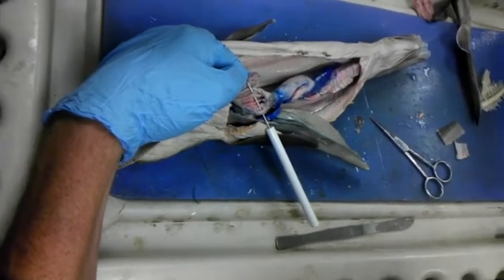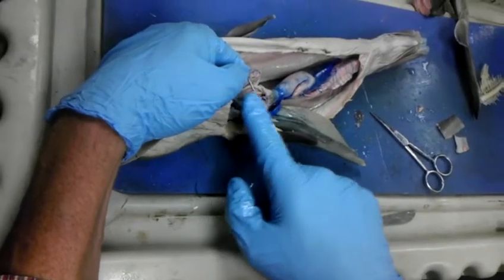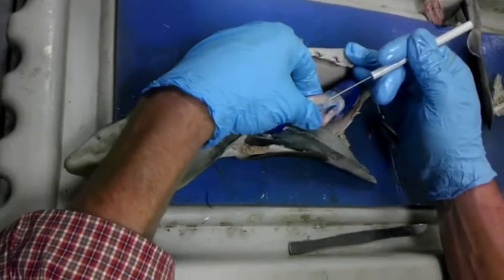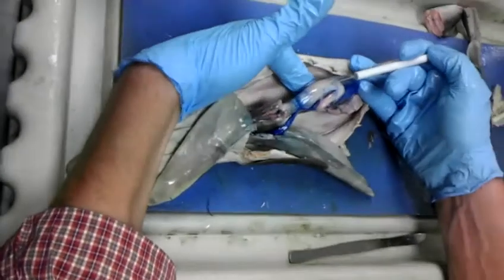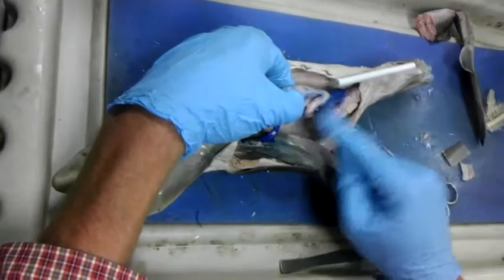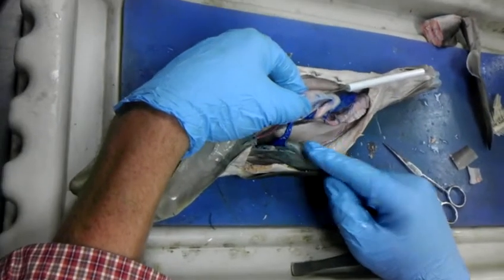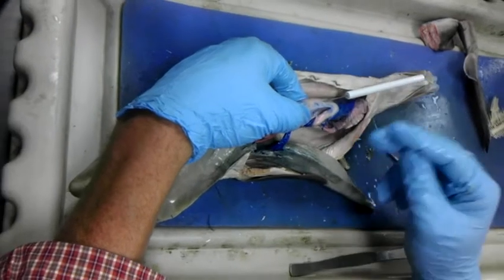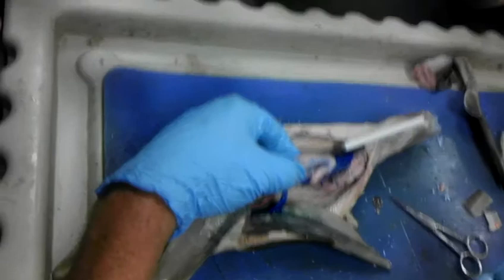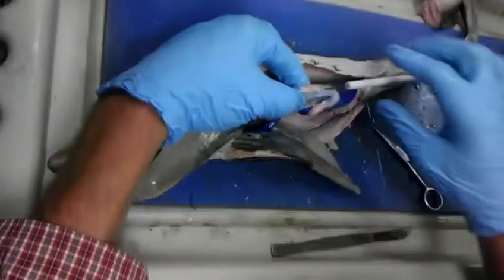Be as specific as possible. So this is rugae. Now, if I was to pin this structure here, what would you say? And this is still the stomach. We haven't got out of the stomach yet. Don't say stomach. Say pylorus region of the stomach.